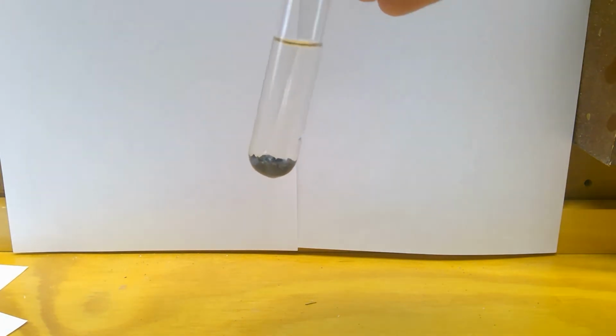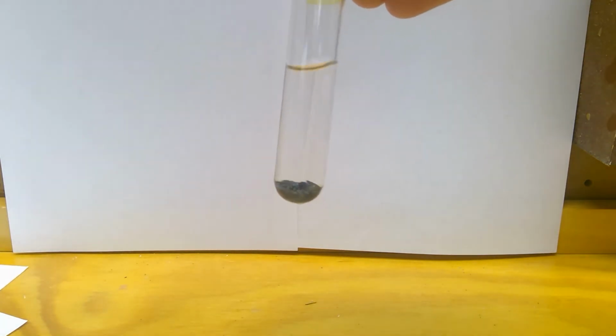So you should know what water looks like. Okay, and here it is. This is what the iodine crystals look like. It's a solid. It's actually kind of purplish. And this is what it looks like when we put it together. So that's box A.